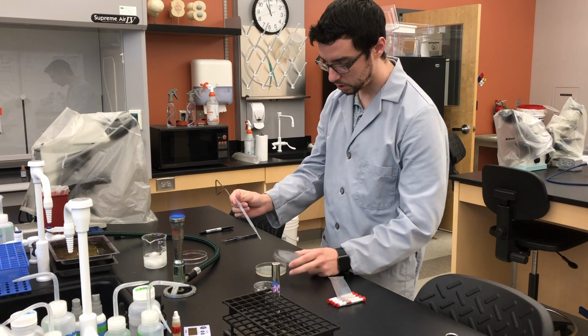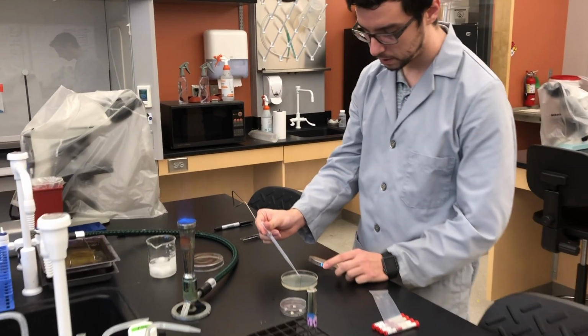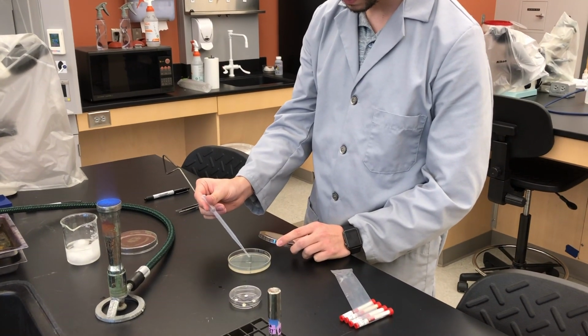You're going to add just 2 drops to the middle.